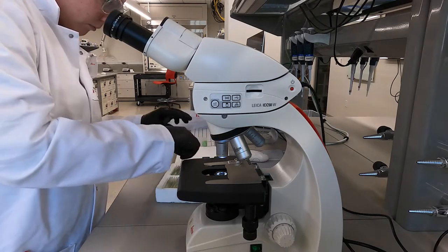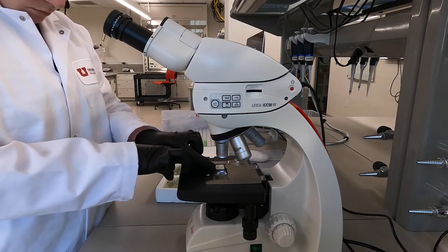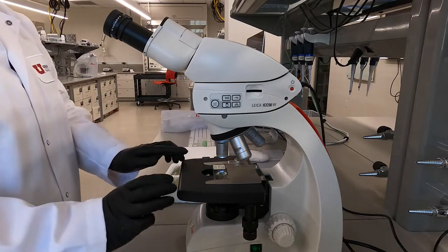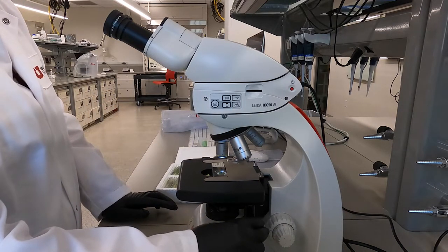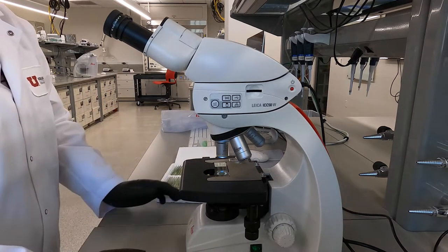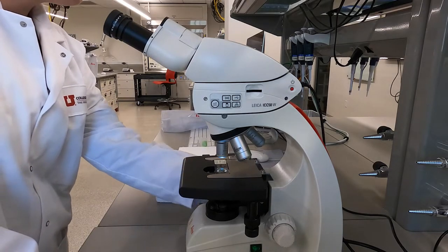Next, position the slide on the stage, making sure to secure it in place with the stage clip and to center it so that a portion of the sample is in the field of view. With the sample in place, raise the stage to its maximum height.